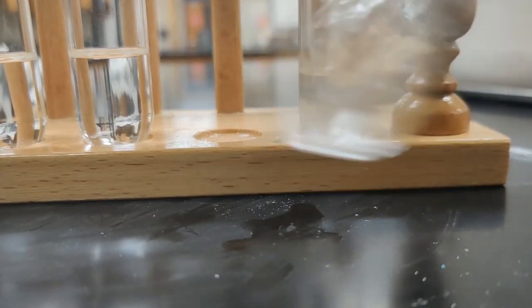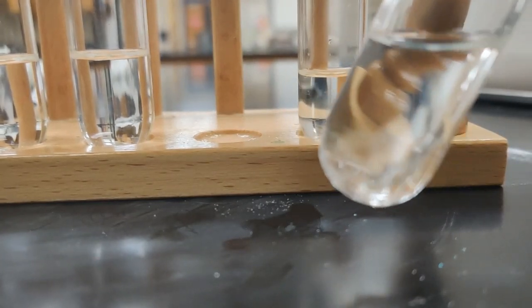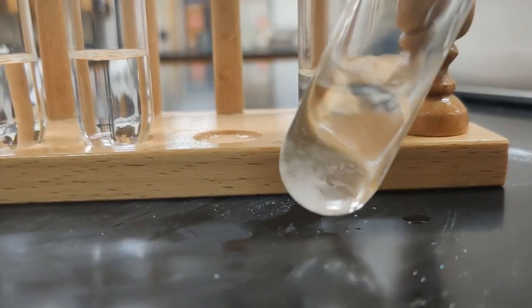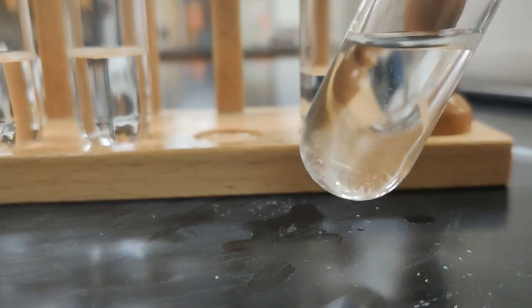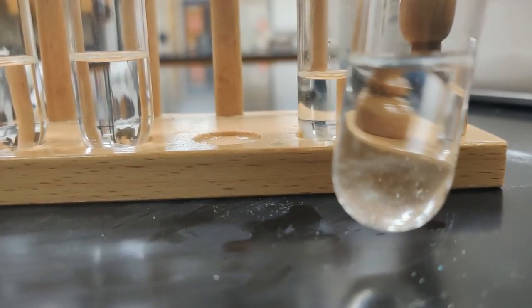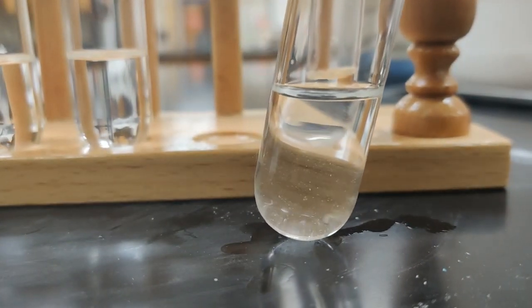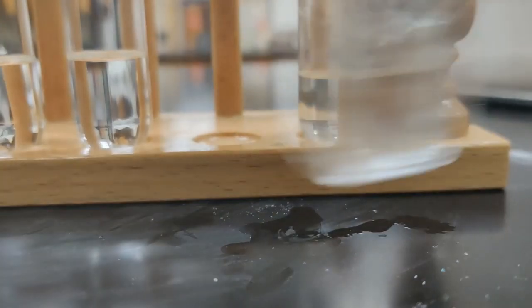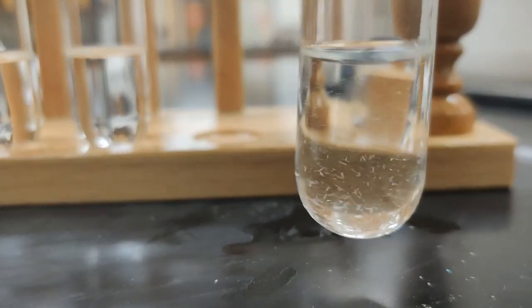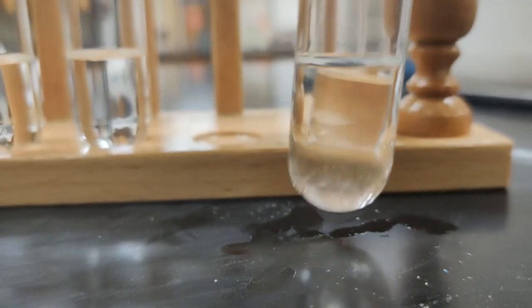So I kind of see that cloudiness when I start to agitate and swirl. So I can still see that cloudiness spinning around. I really don't know that I can say that the ethanol is very soluble. I know from actual life experience in the kitchen that it is at least a little bit soluble, but certainly doesn't appear to be very much.